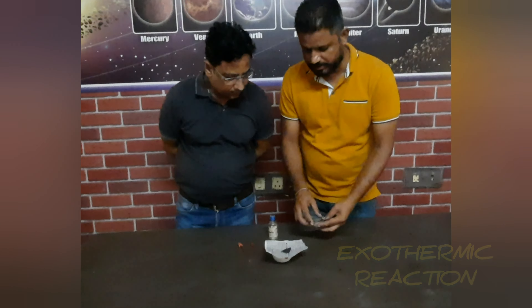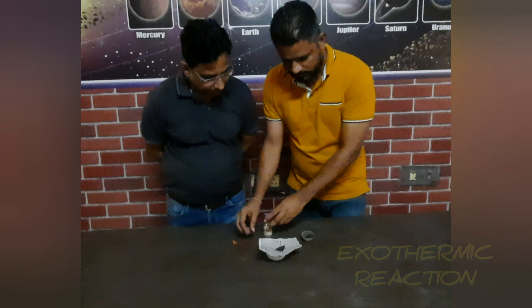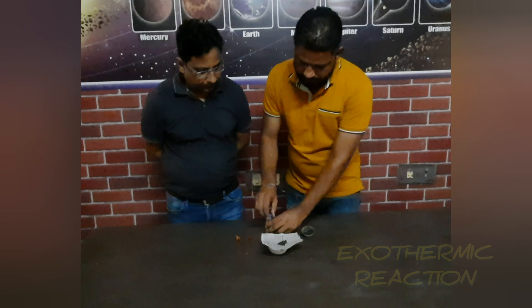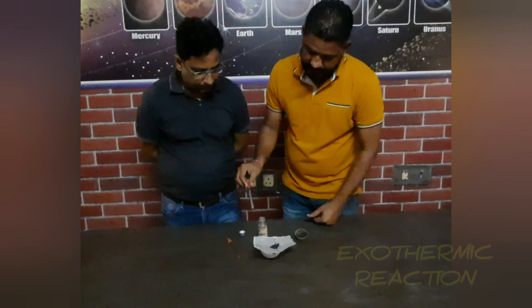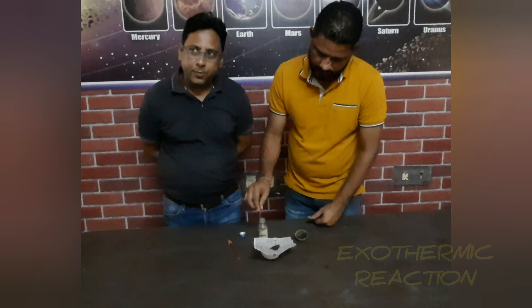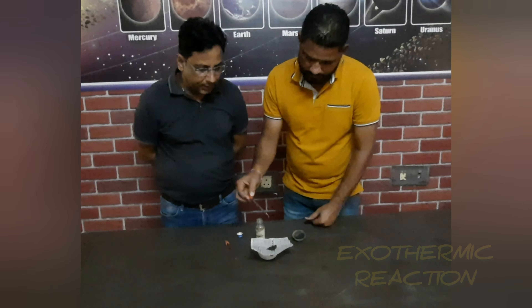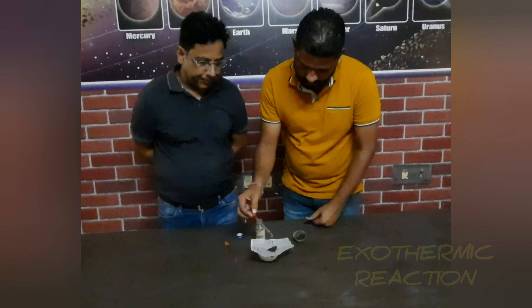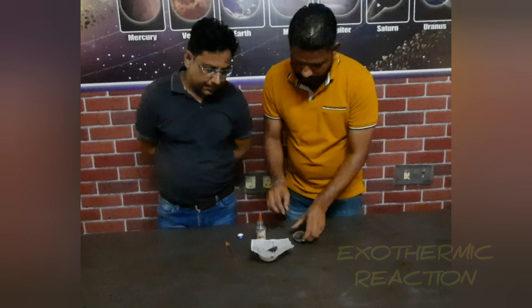Let's take the protection. You will have to wear the protection, like for a test. Right now the reaction will be done.